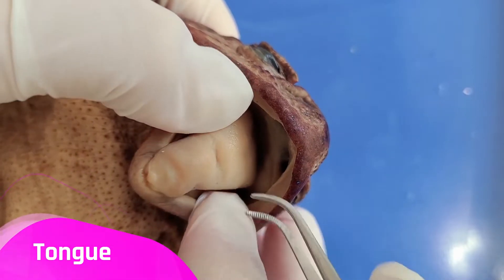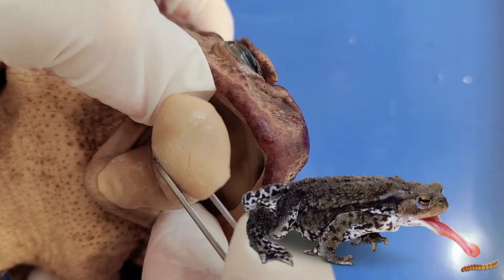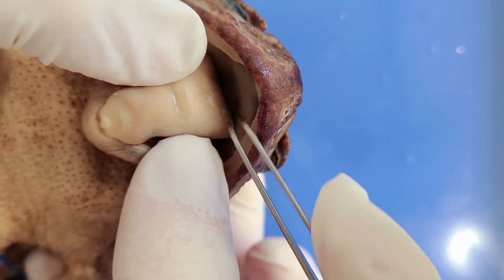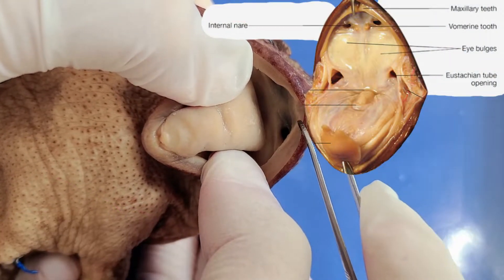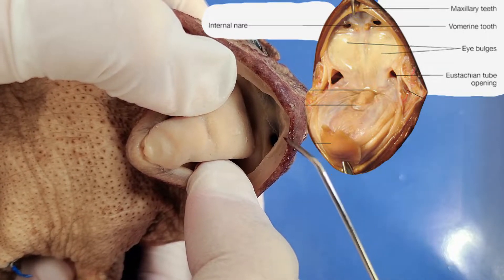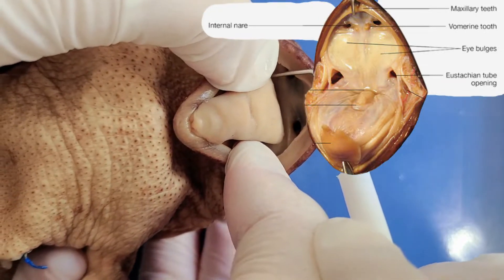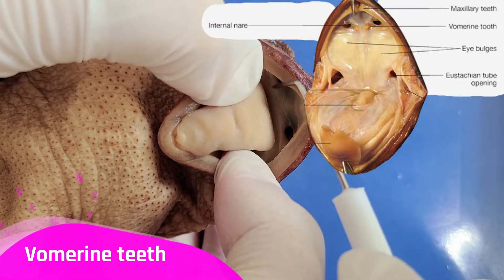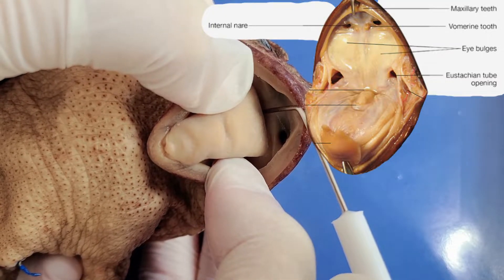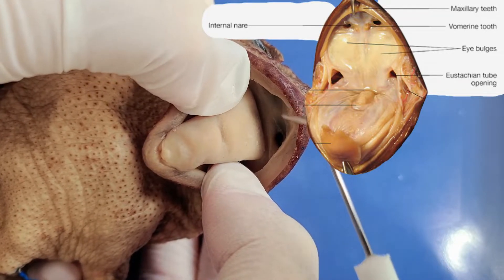If I open the toad's mouth, you can see its tongue right here. The tongue actually flips outwards like this, and the toad catches its prey with the tongue and then pulls it back into the mouth. The toad also has maxillary teeth around the edges of its mouth to help catch the prey — you can see my probe catching on the maxillary teeth as I run it across the edge of the mouth. Toads also have another set of teeth inside the mouth called the vomerine teeth, which basically hold the prey in place while the toad swallows.